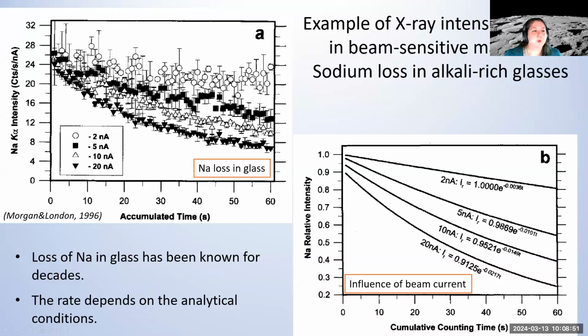And the rate in these, like how fast, how much it drops, as you can see here, is often very strongly correlated with the beam current. So the more beam current we apply, the more of a change we get. And so this is another way to look at it. Again, this is just a simplified way. And so even small increases can have a drastic effect over time.